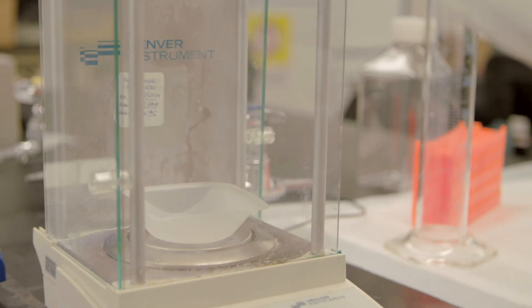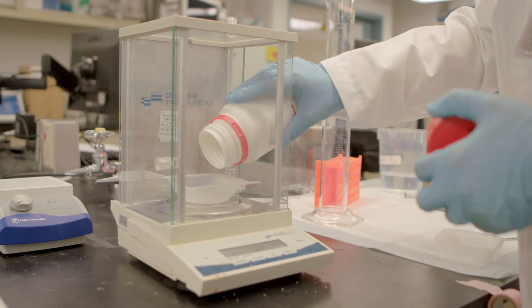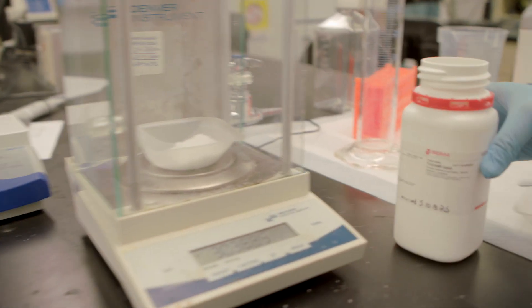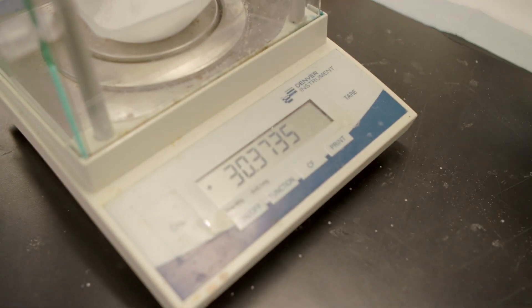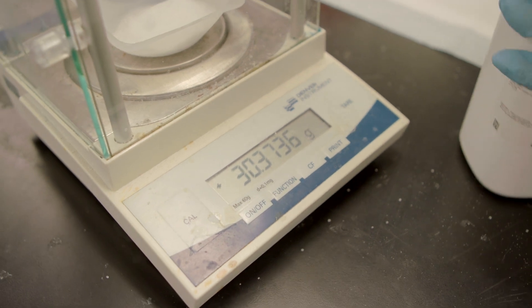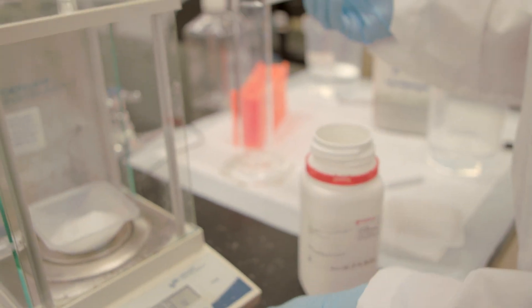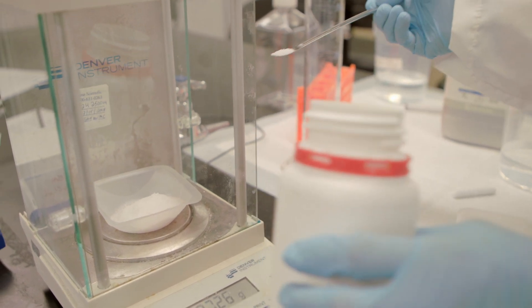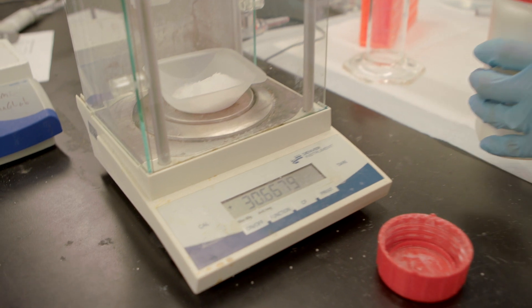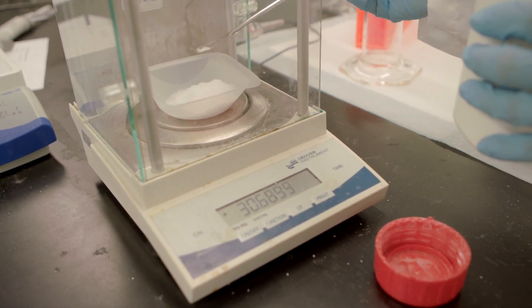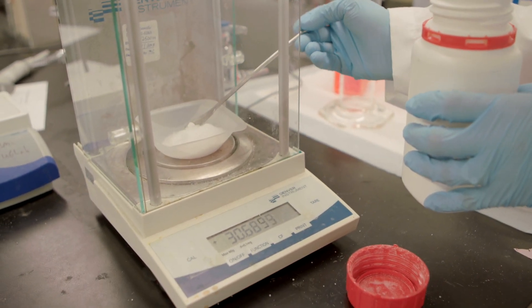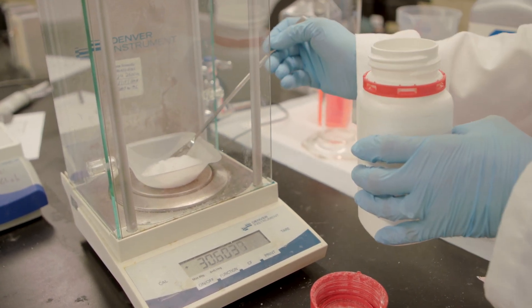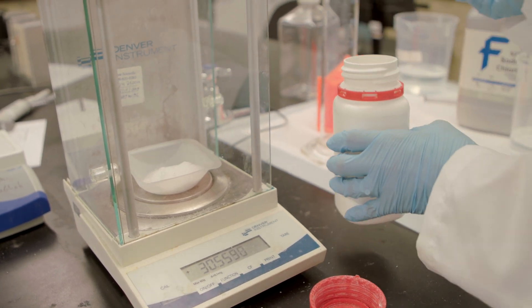Because this is a large volume, I'm going to start by pouring a fair amount. As you get more experience, you get a sense of how much you can pour. So I pour until I get close to what I need. I need 30.5 grams. Because I have experience, that's very close. Then you use a scooper, sometimes they're metal, sometimes they're plastic, to either add or take off until I get to the close amount. So I'm going to scoop a small volume and add it bit by bit. I'm going to remove a little bit until I get 30.5. There we go, 30.55.